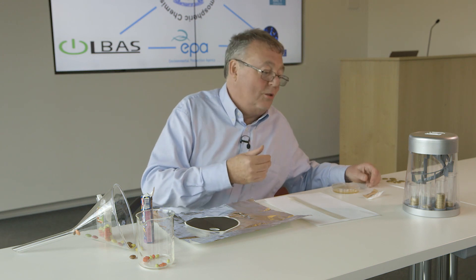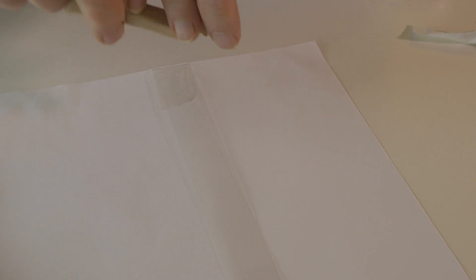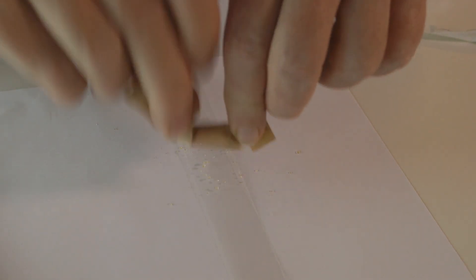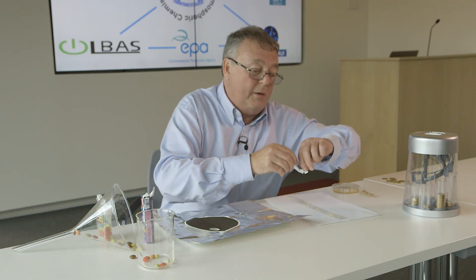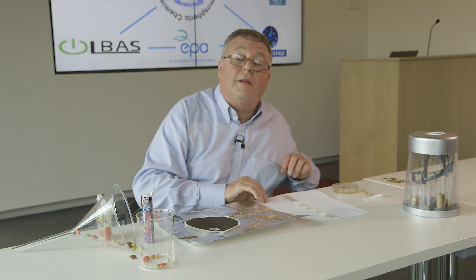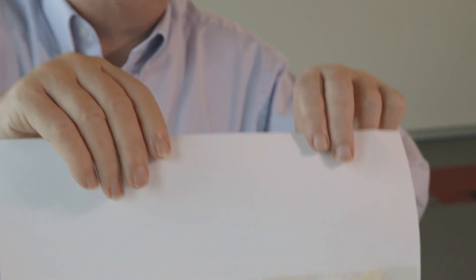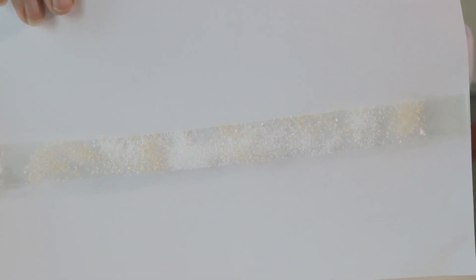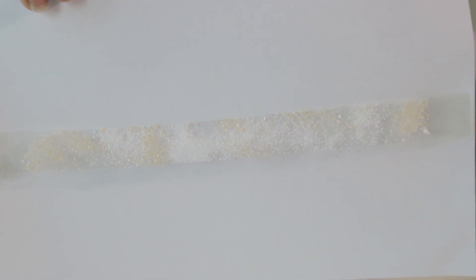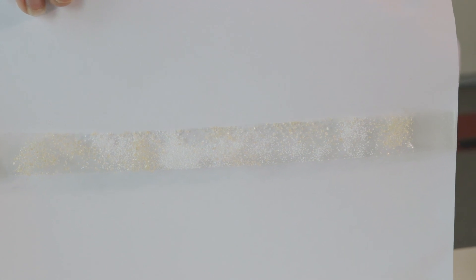Here is a biological method for measuring things like pollen and spores. What we do is simply use a bit of sticky tape. In the atmosphere, you get pollen and spores being sucked onto the sticky tape. We then take that sticky tape to an optical microscope and try to count and identify what's there.